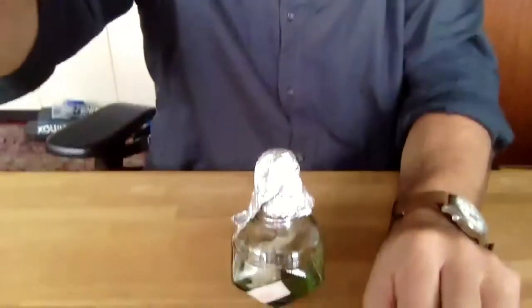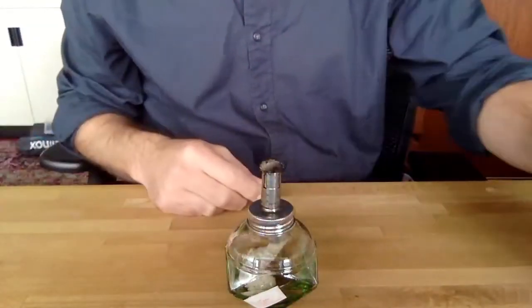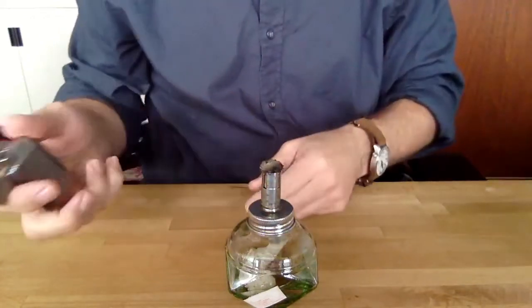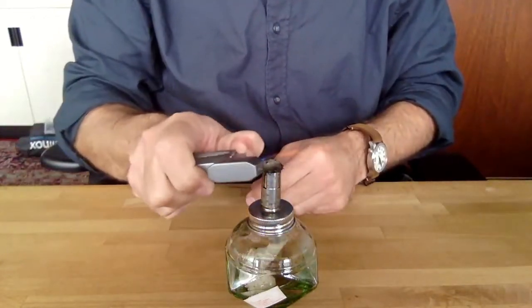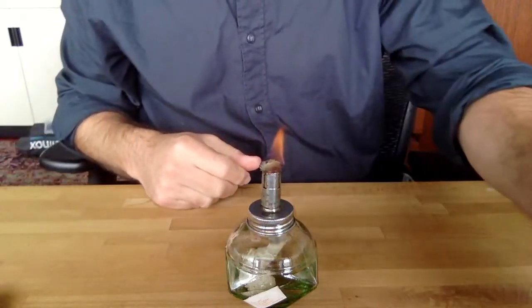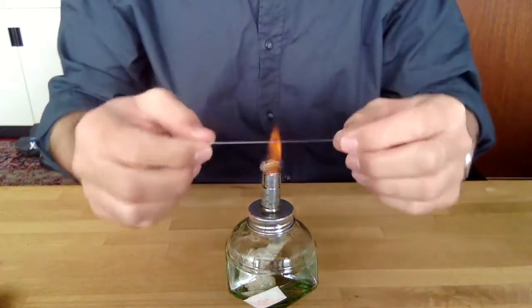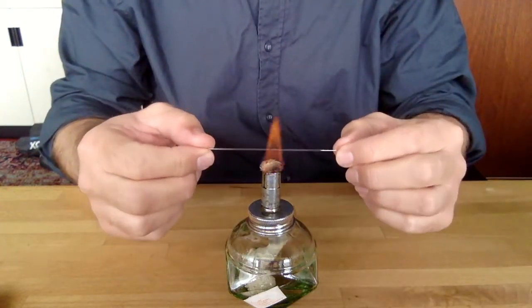So what do you do? First step, I'm just going to tilt this down, and I'm going to use this ethanol lamp just because I don't have enough hands to hold this. But theoretically, you can do all this with your lighter. I should add, the ethanol lamp isn't actually very hot, so it's not very good for this. It's much better to use a lighter.